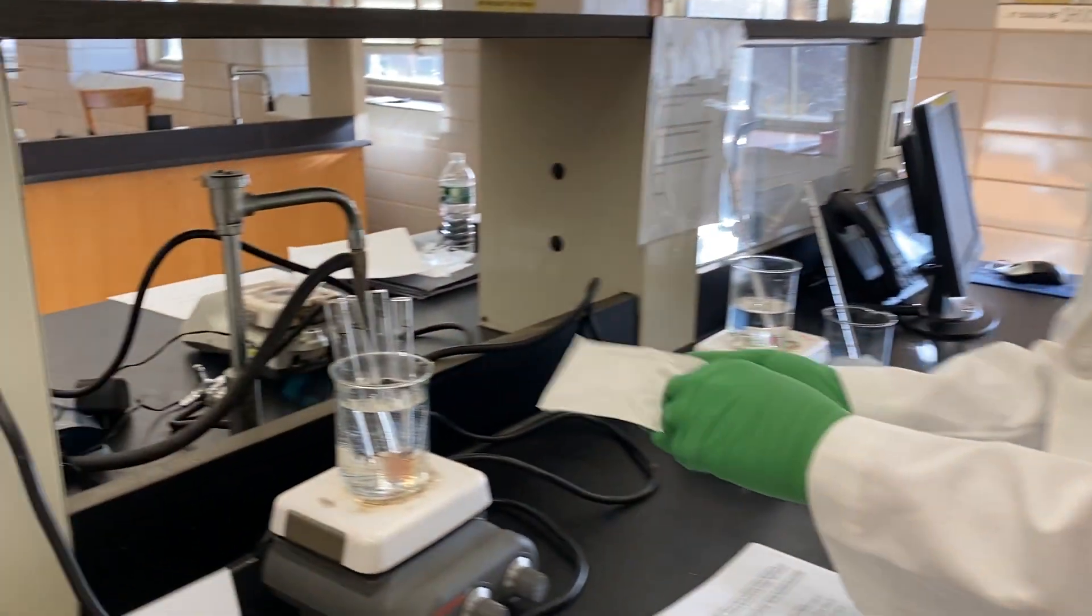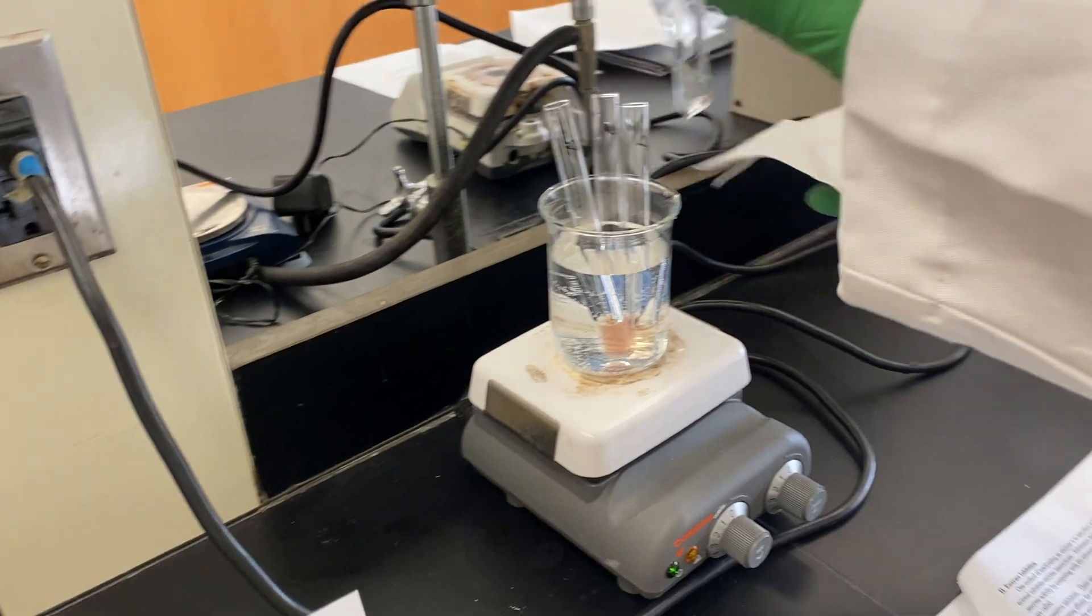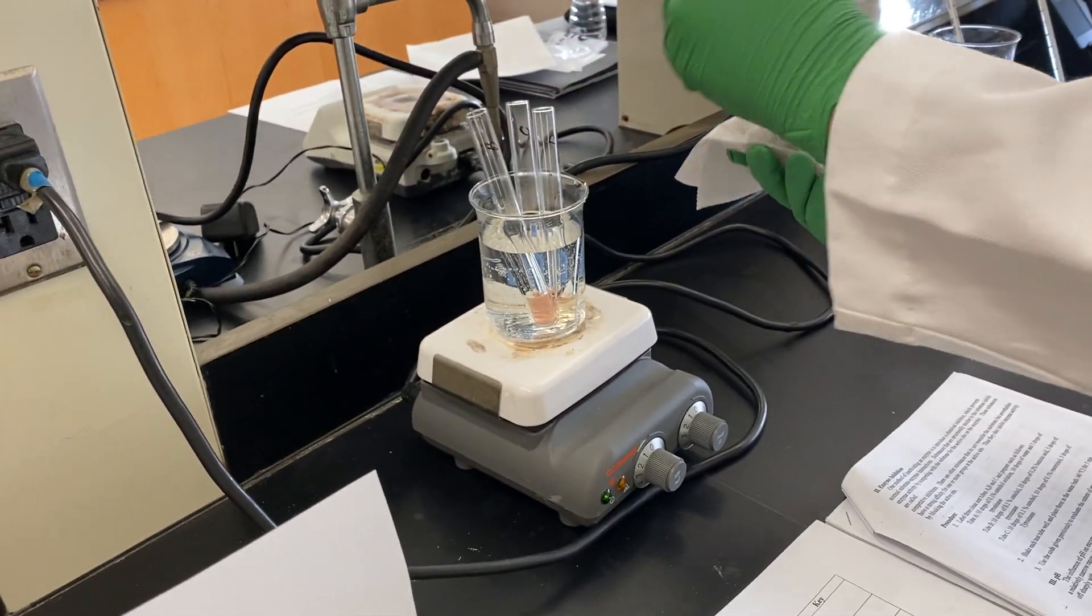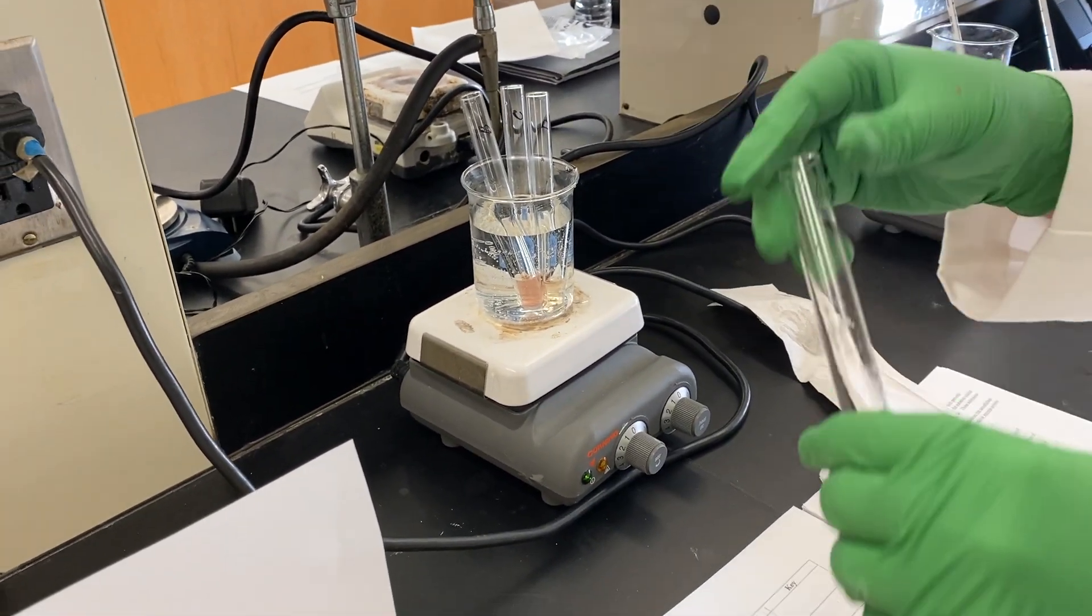Let's check. Now they've been in the water bath for 15 minutes. You saw that some of them actually changed before they even were in the hot water bath.